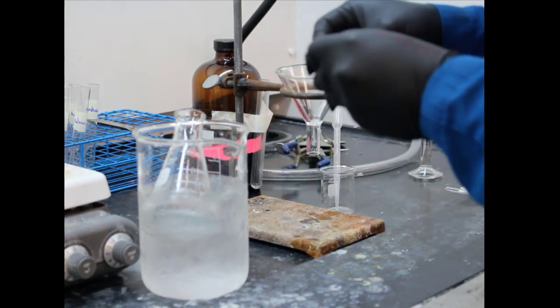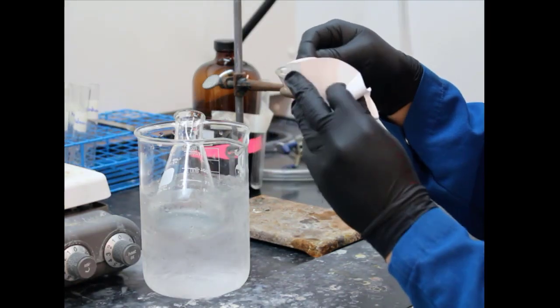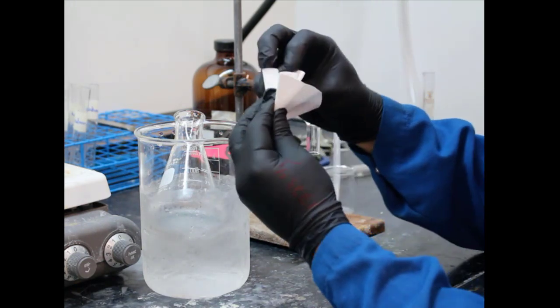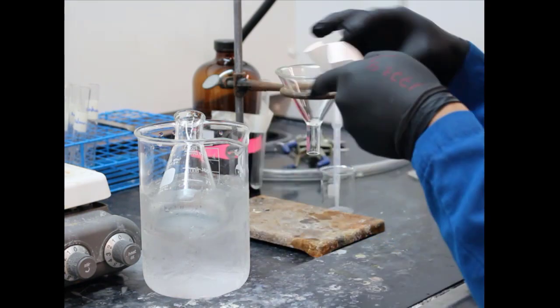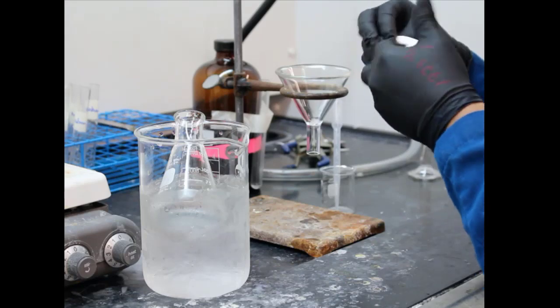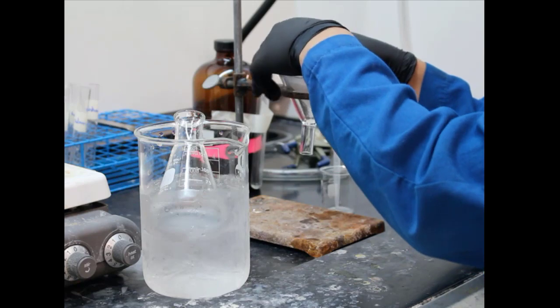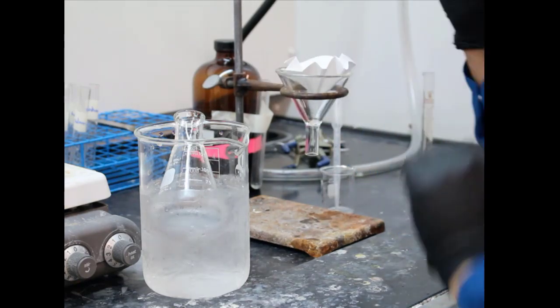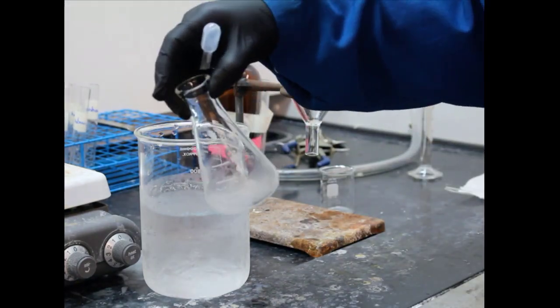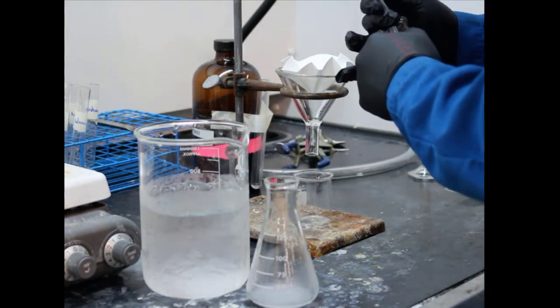All right, so now they're ignoring the ghost in the fume hood, and they're setting up another lotus origami for the filter paper that they're going to put in the funnel. And now what you're going to see when they pick up the Erlenmeyer, since it's been in the cold water, all right, all of the molecules that went in the water precipitated out because it was cold. You can see it's all milky looking.